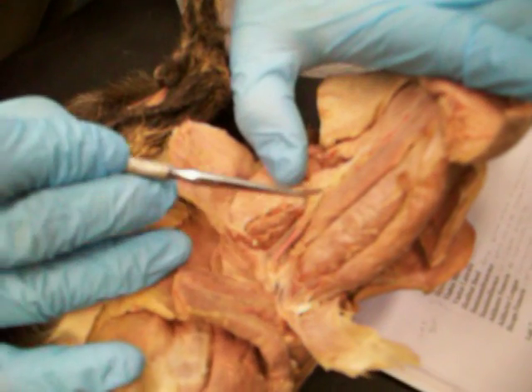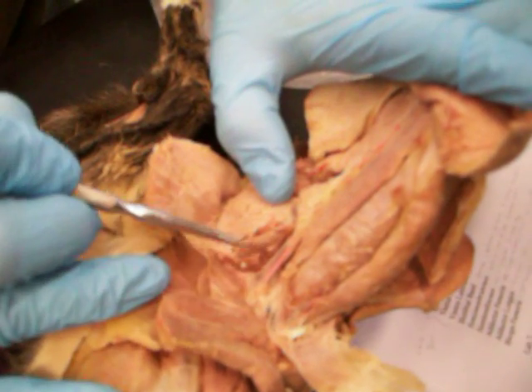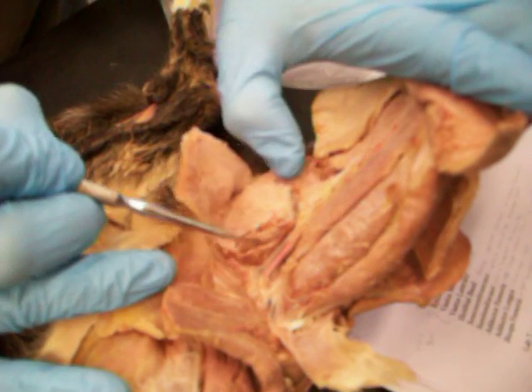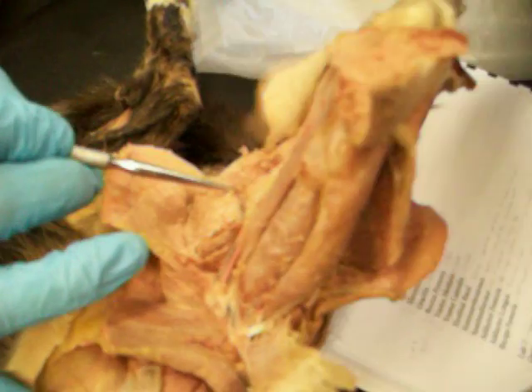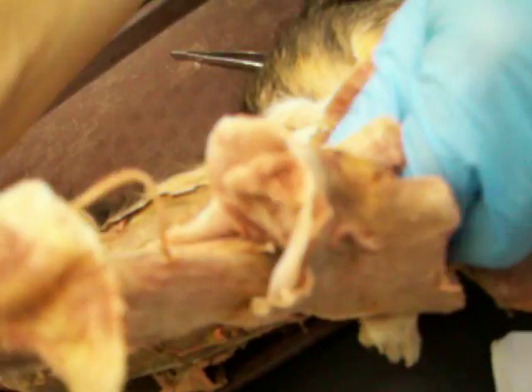On the inside of the leg, there's the artery and vein. This dark little muscle right here is the adductor longus, then the adductor femoris is the big white muscle below it, and right below that is the semimembranosus, which you can also see if you lift up the back of the leg. Semimembranosus is all of that.